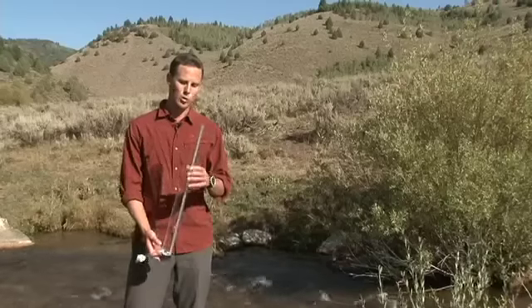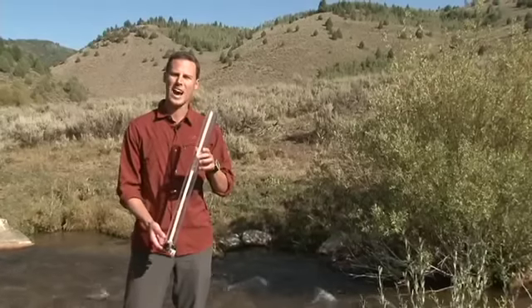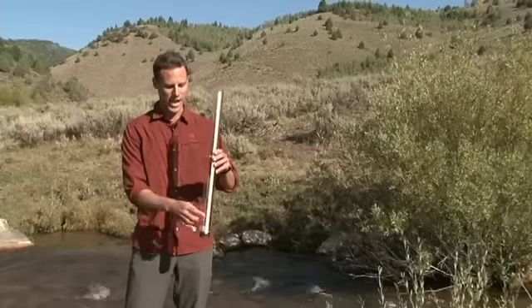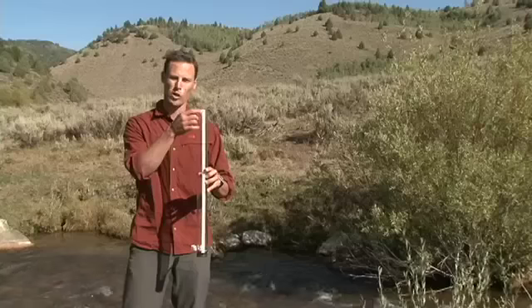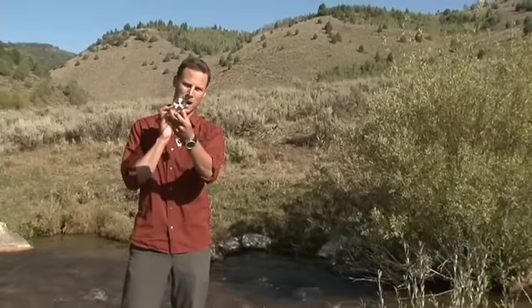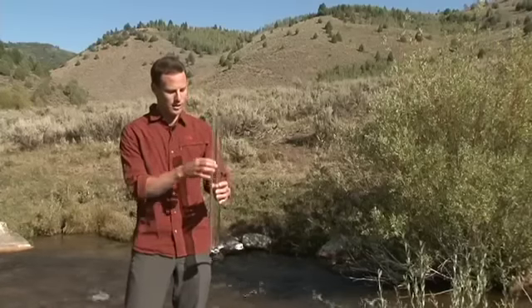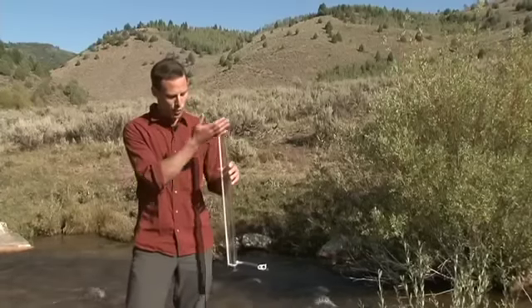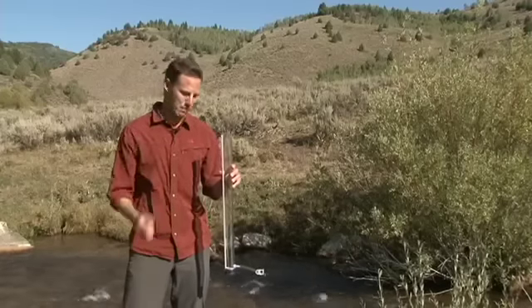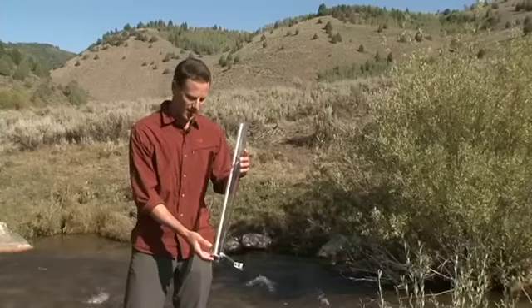In a stream, we use what's called a turbidity tube to monitor how clear the water is. If you look at this tube, it has a ruler on it with centimeters, and way down at the bottom is a white and black disc. We fill this tube all the way up with water and then we can lower it to the level when we can just start to see the white and black disc. That tells us how clear the water is.